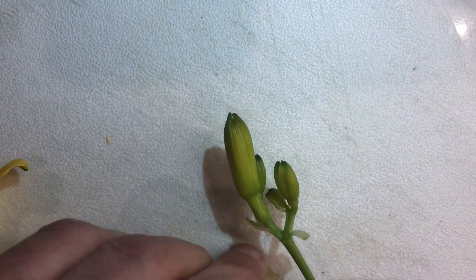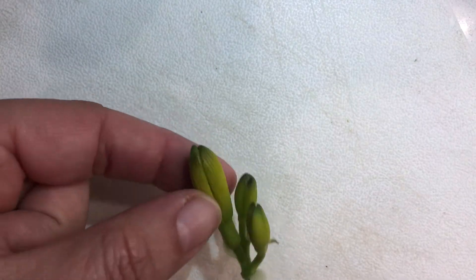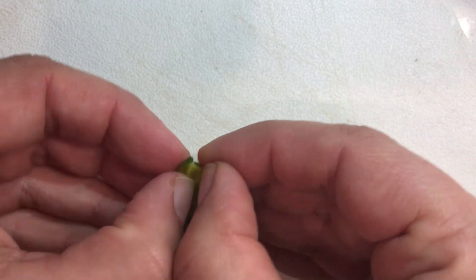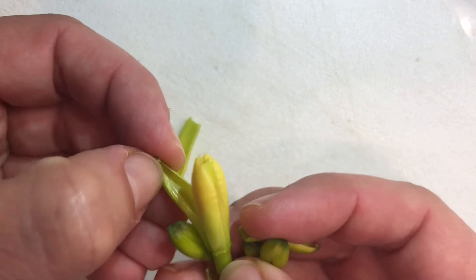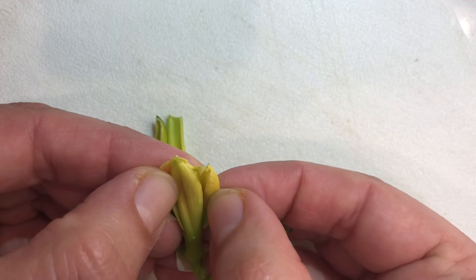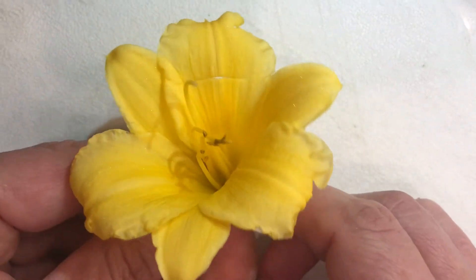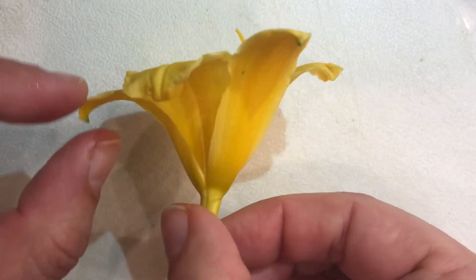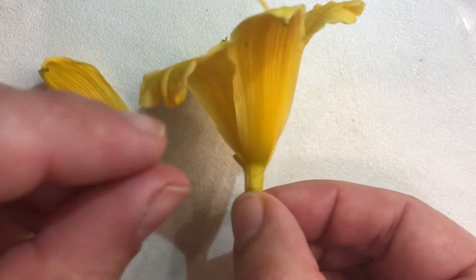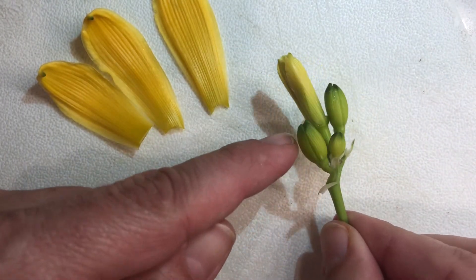Let's look at these buds that have yet to bloom. The outer part protecting the bud — those are the sepals, and when the sepals open up in the blooming process is when the flower petals would be shown. On this bloomed flower, the sepals look like petals but they're still there — they've just turned yellow. They're these lower, outermost modified leaves on the base of the flower. I'm going to take off the three sepals of the lily — remember, the sepals are what were those green things covering up the flower bud.